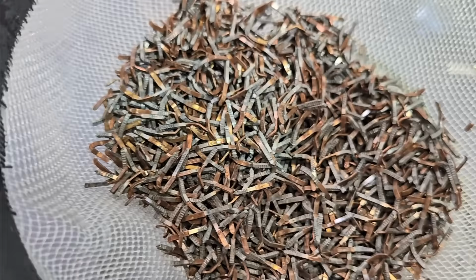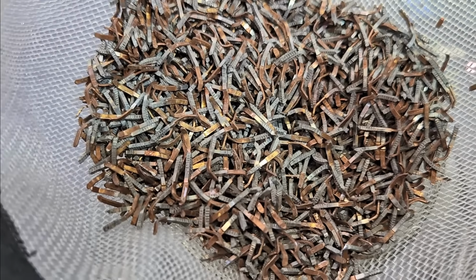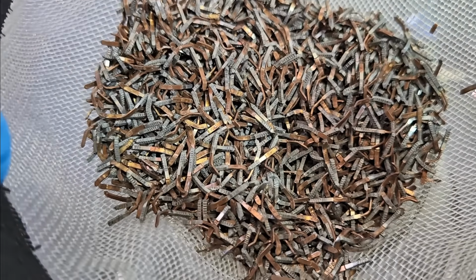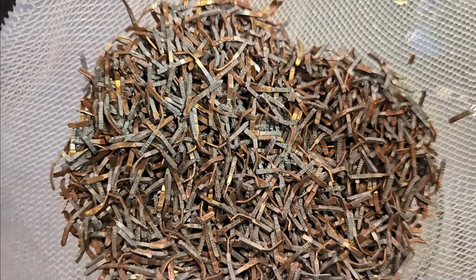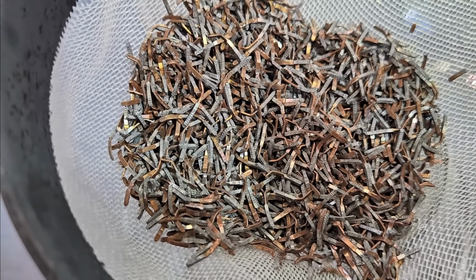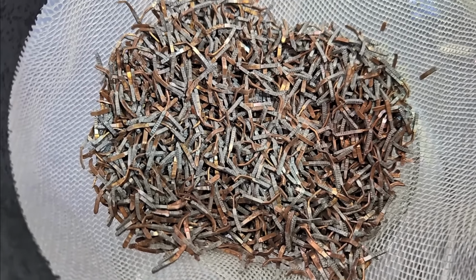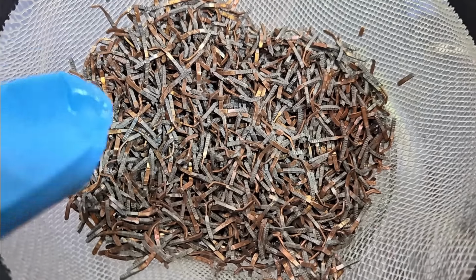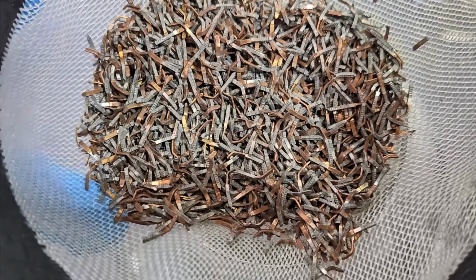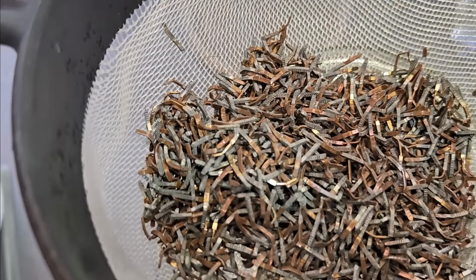They're not perfectly clean, although I think they look pretty good for the most part. But yeah, there's definitely some gold here and there, some gold down there, some gold down there, some gold down there. I think we got the vast bulk of it off. I think I know what I did wrong. And I even intended to do this before we started, and I forgot. I was going to tumble the pins for a while in soapy water to get them good and clean. The remaining gold, maybe because there's oils or grease left behind on those that's preventing the leach from getting to it. That's possible. Let me mix them up a little bit here.